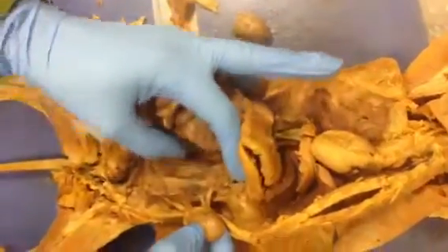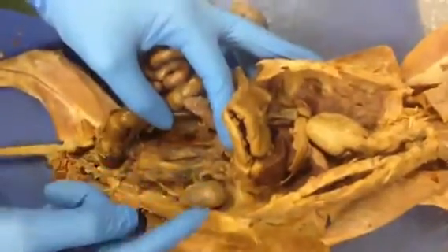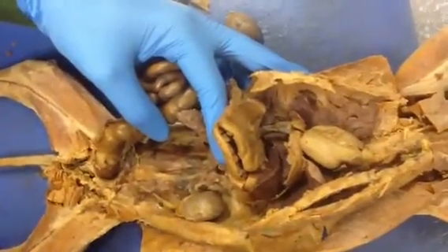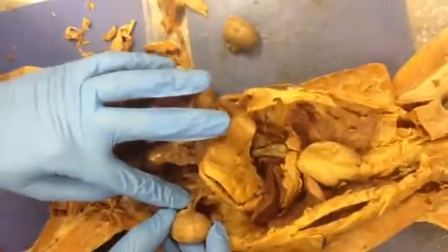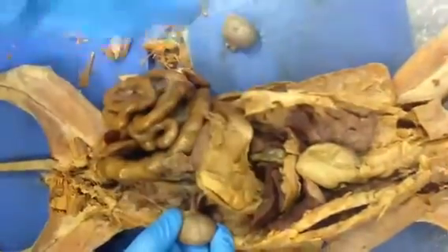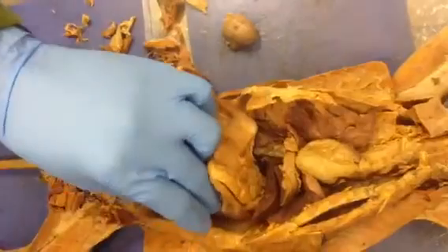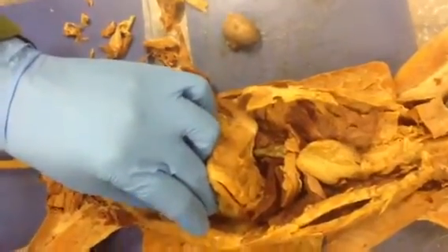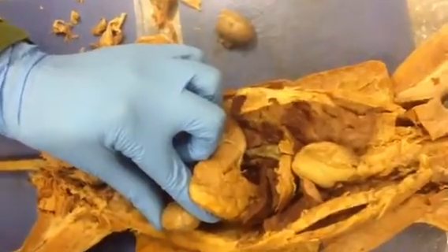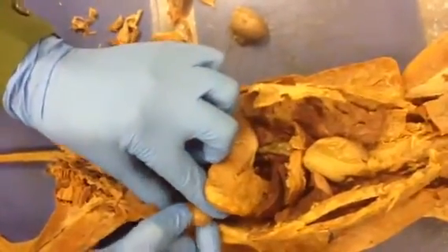Now, arterial supply, you can also identify. I want you all to trace and dissect. Don't use a scalpel. Just use the probes and separate the renal vein from the renal artery and trace them to the vena cava and the aorta, which would be relatively easy. Then cut your kidneys. Cut one of them at least, either the right or the left.